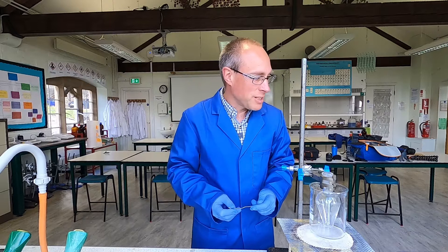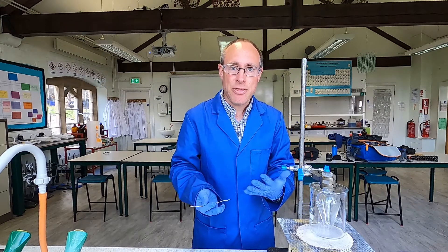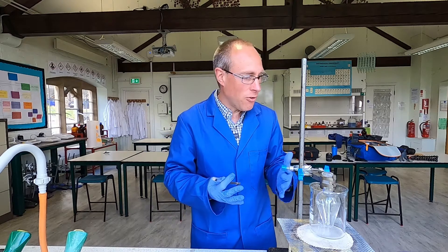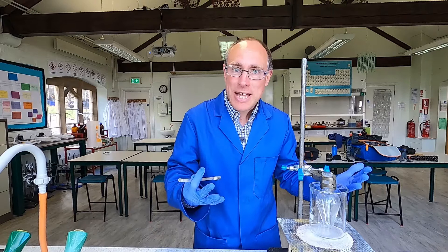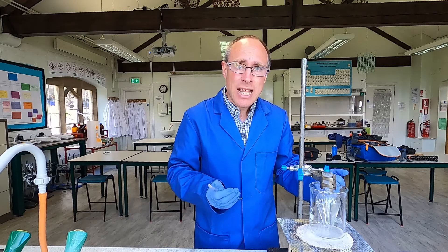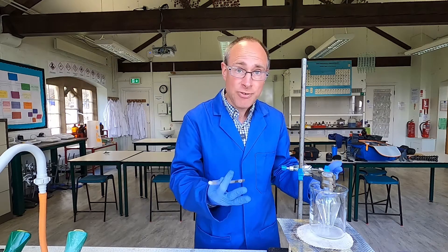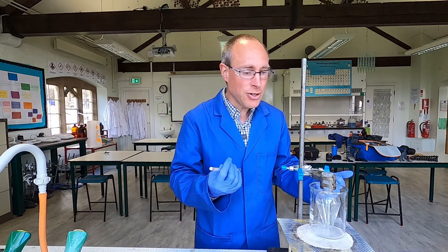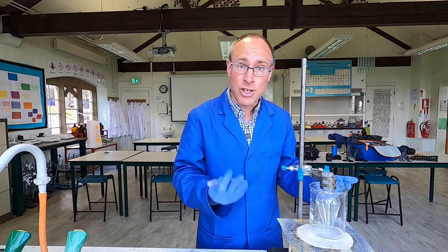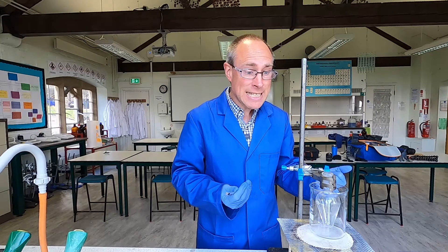In this experiment, I'm going to oxidise ethanol to ethanoic acid. This is a full oxidation of ethanol without burning it all the way to carbon dioxide and water. This experiment involves us having to reflux the ethanol with a mixture of sodium dichromate and sulfuric acid.